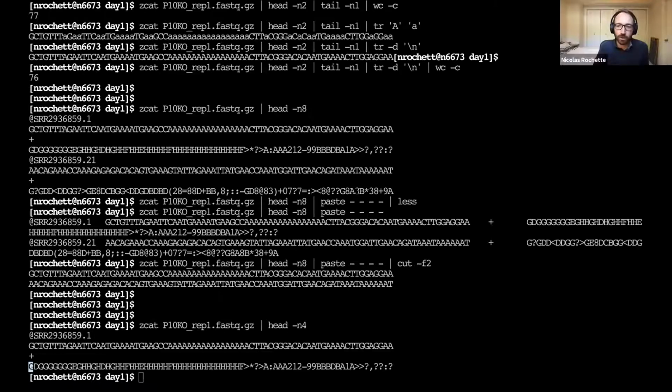And then how many lines does the file have in total? So that's actually going to be the same, not exact same, but a very similar command we use for the samples.txt file, just counting the number of samples. And the same way we counted the number of samples, we can count the number of lines in our FASTQ file.